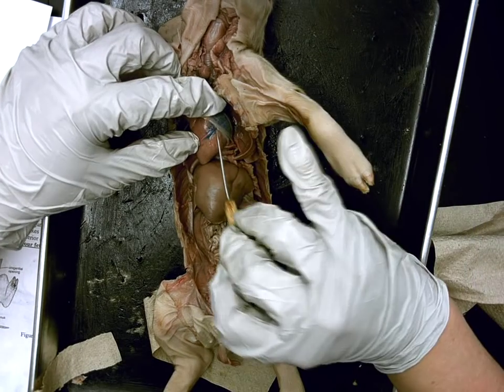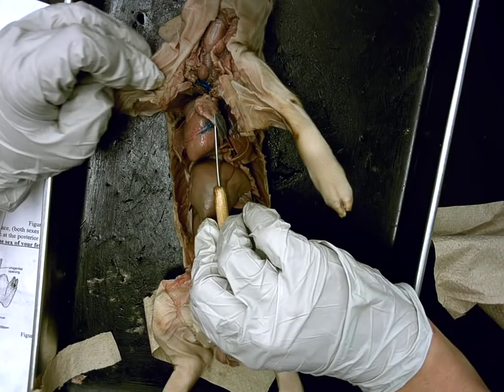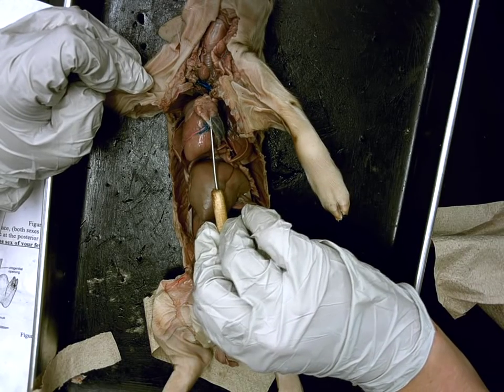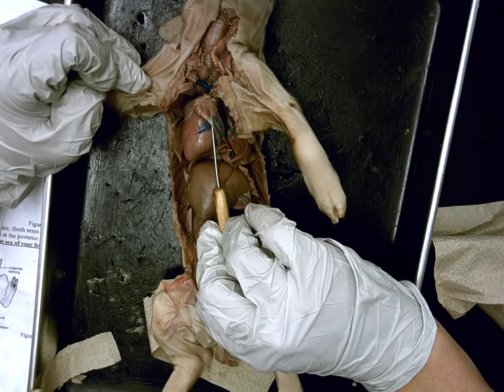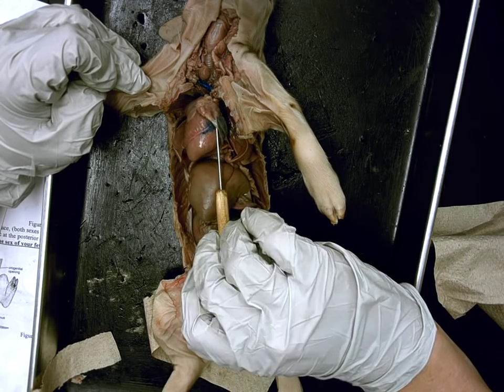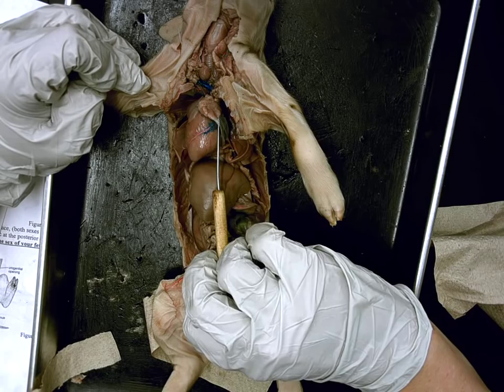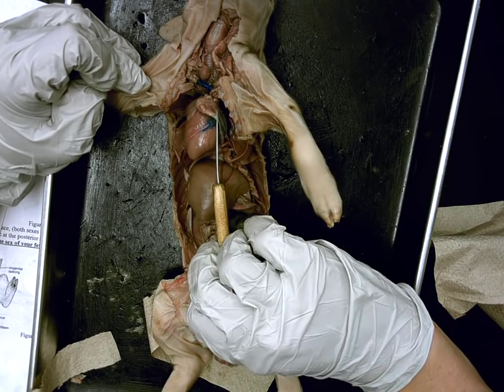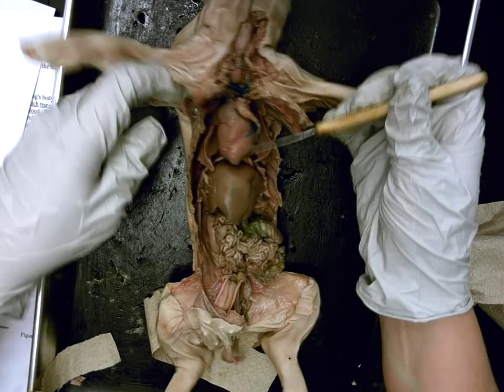There's only just a little bit left here, but if I pin this tissue that was right around the heart, what would this tissue be called, Carla? Peritoneum? Hmm. Does anyone know this one? Pericardium. Pericardium — which is the tissue that surrounds and protects the heart.